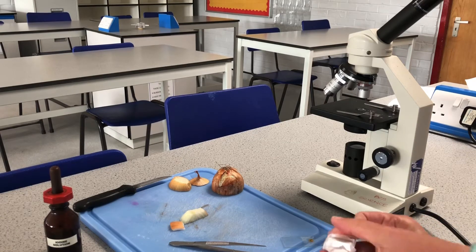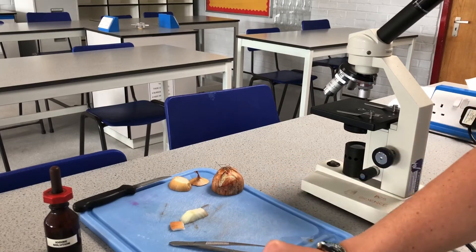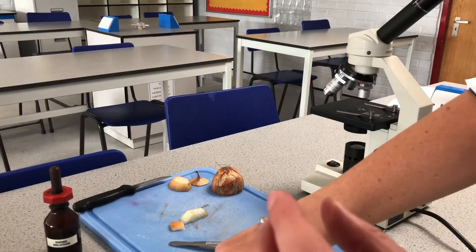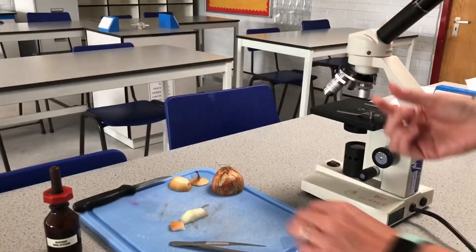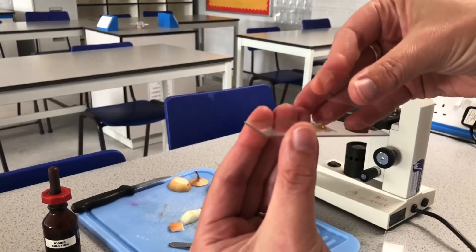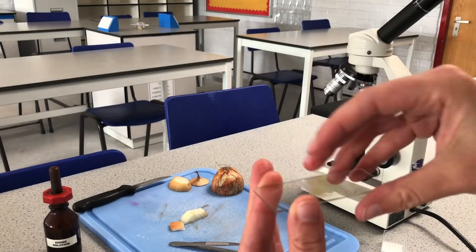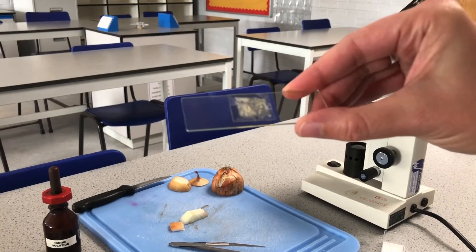The microscope slide is the bigger piece of glass, and then we have these really fine microscope cover slips — even thinner pieces of glass. I'm going to take one really fine piece of glass like that, which is going to sit on top and keep the sample nice and flat. I hold it on one side, give it a little tap, and there it is in place on top of the slide.